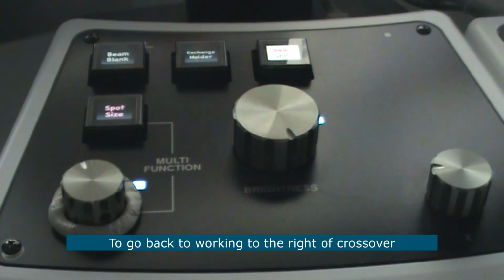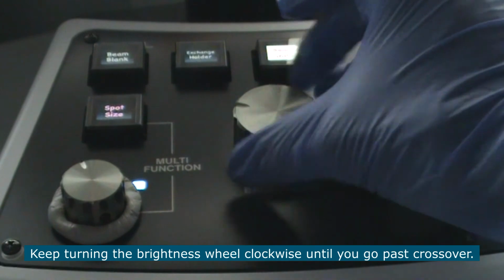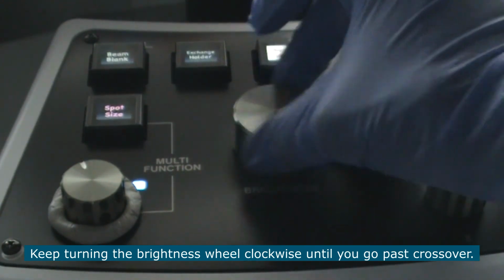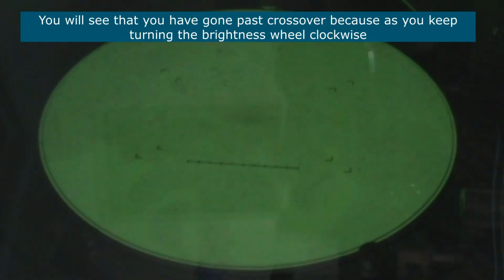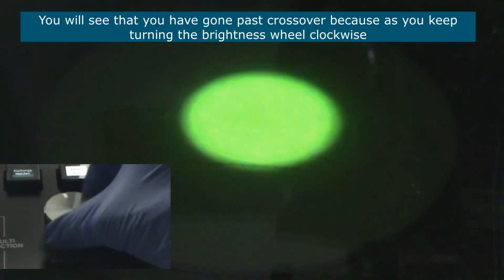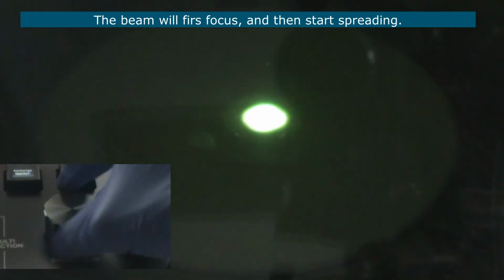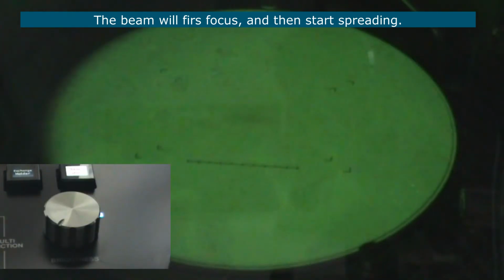To go back to working to the right of crossover, you should then turn the brightness wheel clockwise until you go past crossover. You will see that you have gone past crossover because as you keep turning the brightness wheel clockwise, the beam will first focus and then start spreading.